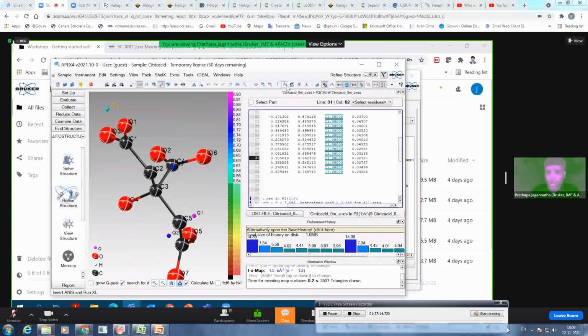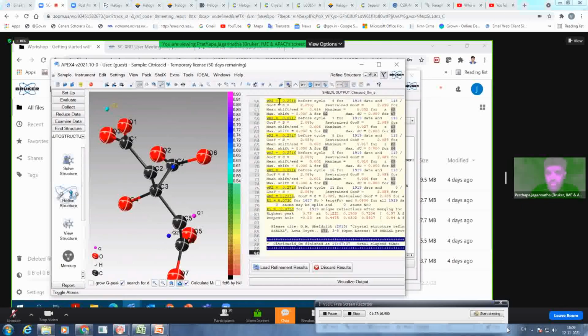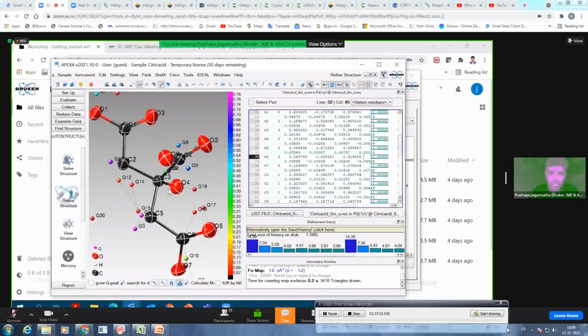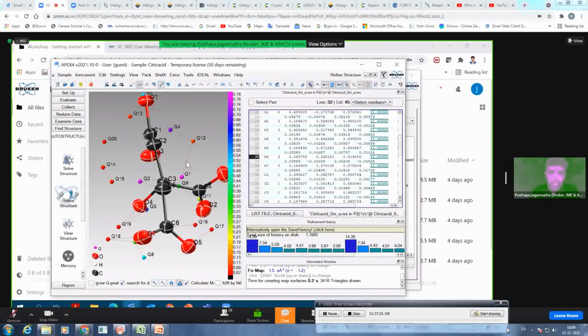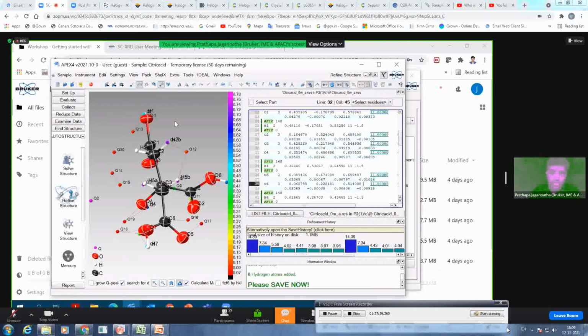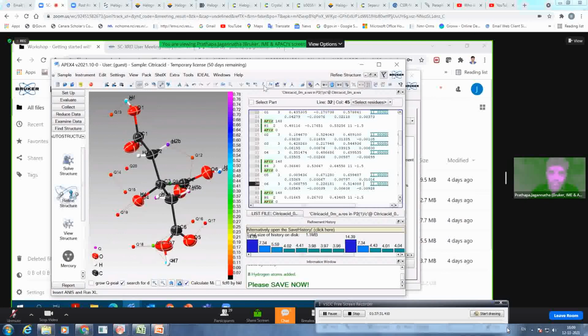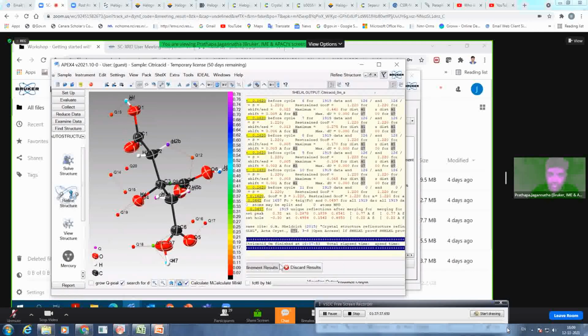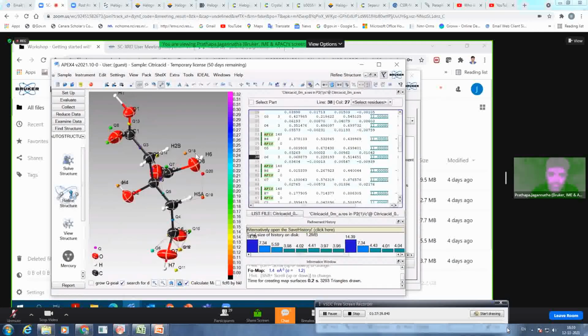So then you can do anisotropic refinement down to 7% with 0.78 as the highest residual density. That is because of your hydrogen, which still has to be added. An easier thing is ShelX automatic HFIX you can do. You have fixed the hydrogen. You can do the refinement again. You are down to 4.4 with almost nothing left in the electron density.